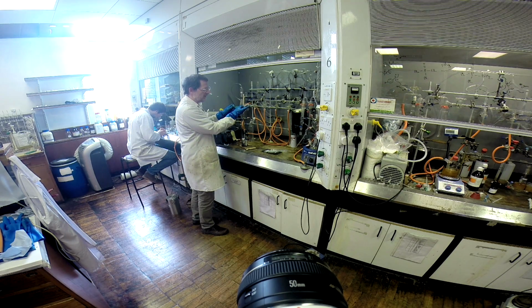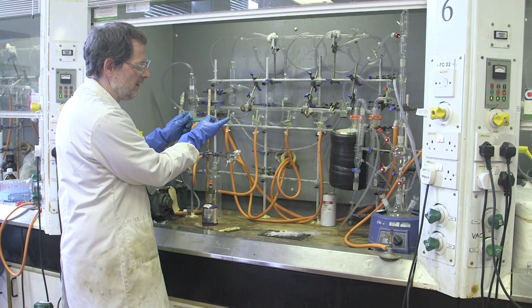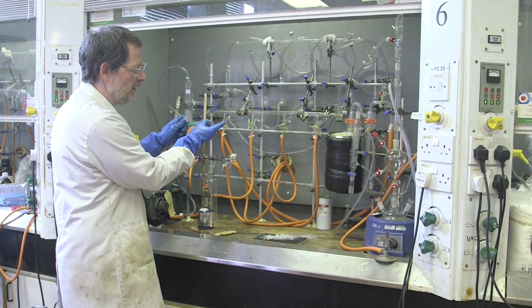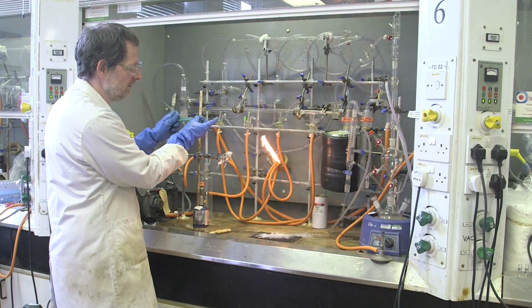Here's the compound in air. We're just going to release this slowly. We're going to see a bright yellow flame and oxidation.